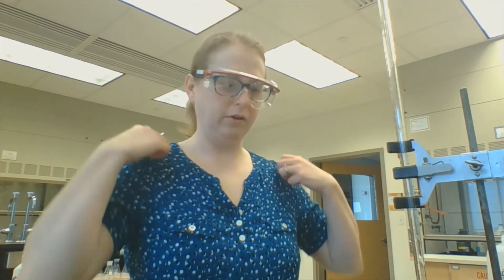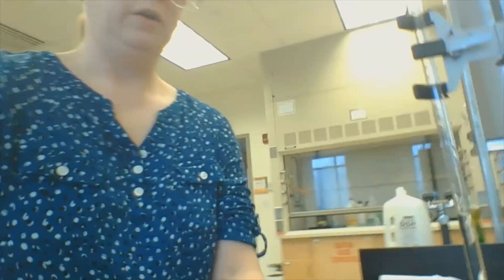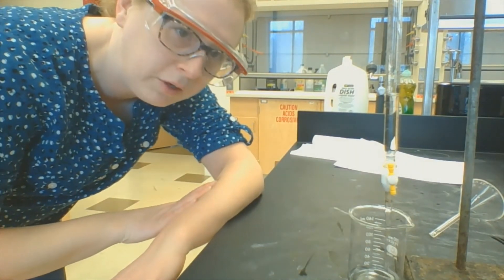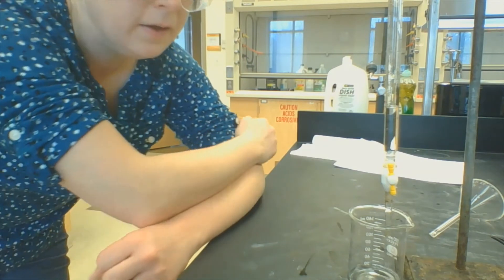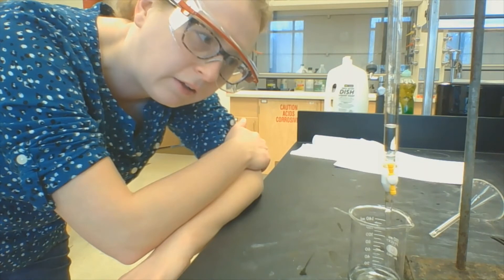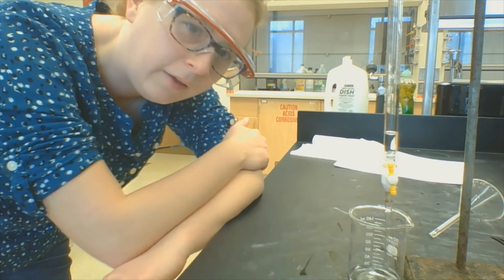One thing that's interesting about these burettes is that if there's not enough liquid in them, no liquid will flow because there's not enough air pressure from the top to push it out. So make sure you've filled it far enough before asking why it doesn't work. I let it flow all the way through so I know I'm getting enough cleaning through the tip of the burette.